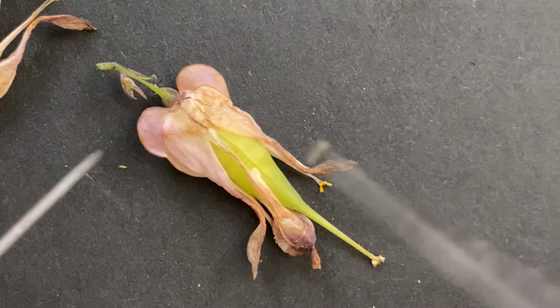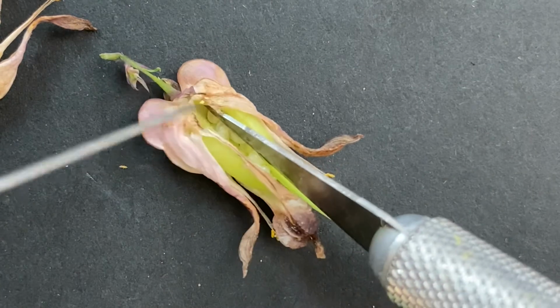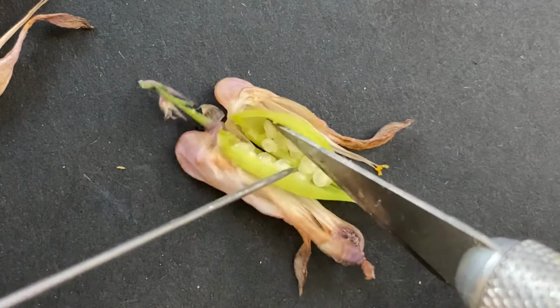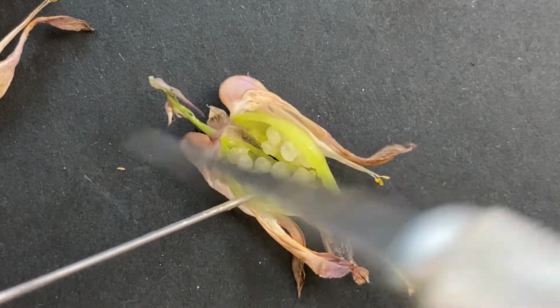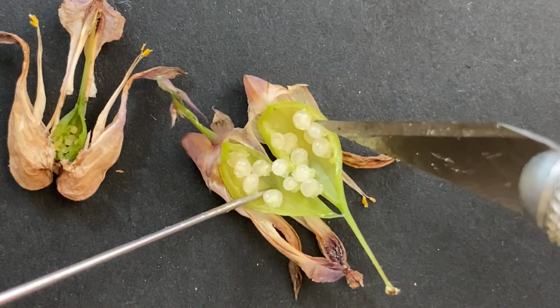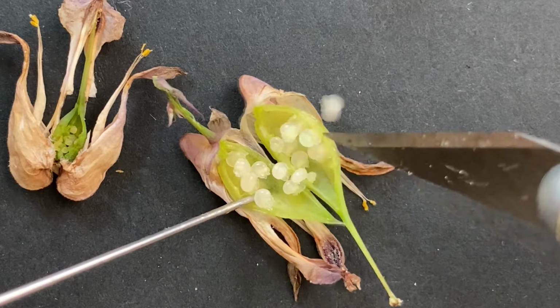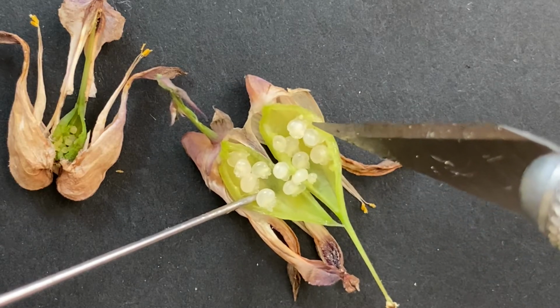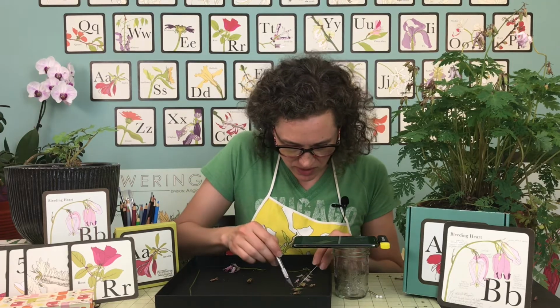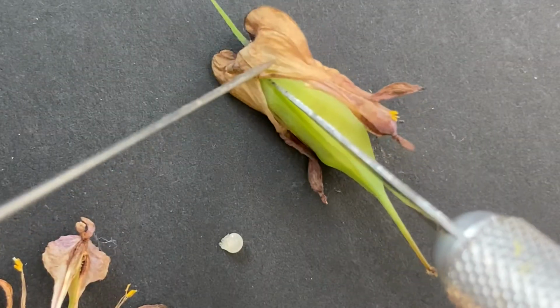And then let's see if we can cut open this ovary. See what's happening inside. Yes, wow. So look at that. Instead of these really tiny ones, like we had over here in this dried up one, these are nice and round. They're still attached. See how they're still attached to the sides of the ovary? They're getting bigger. And then we'll see, hopefully, this one might not be ready yet. If it isn't, I'll find us a better one.